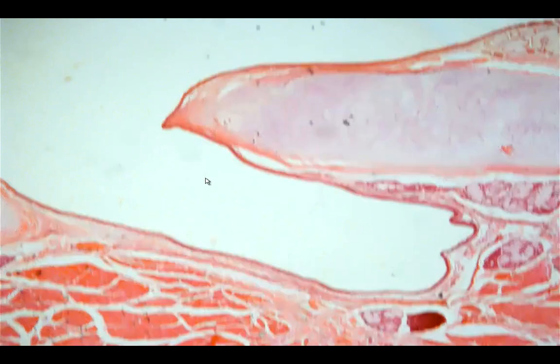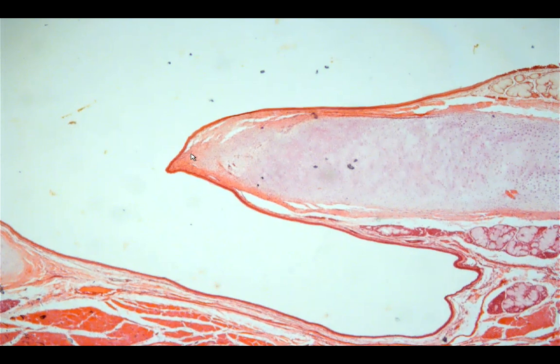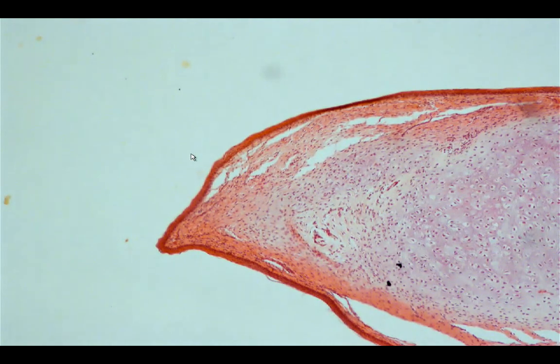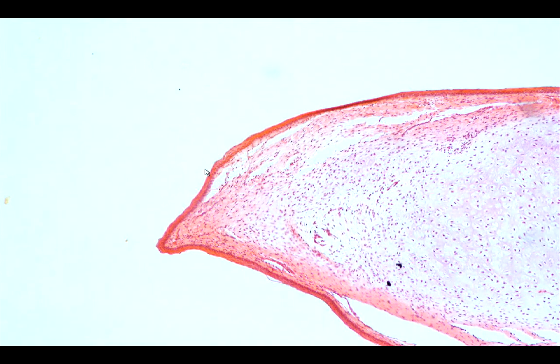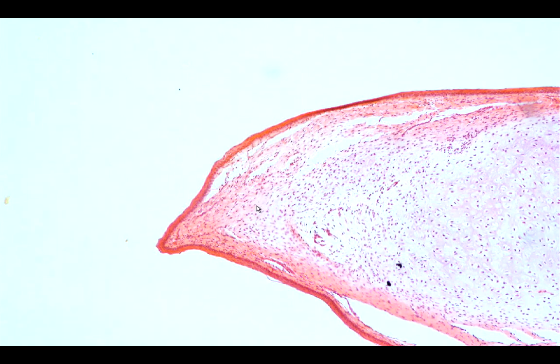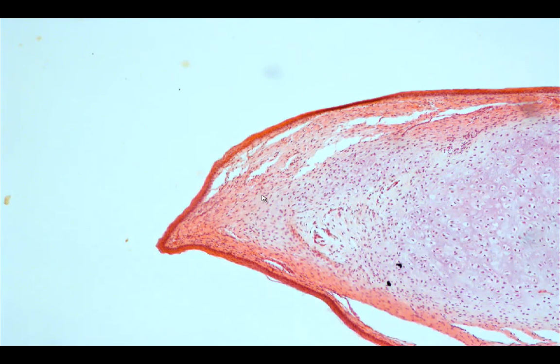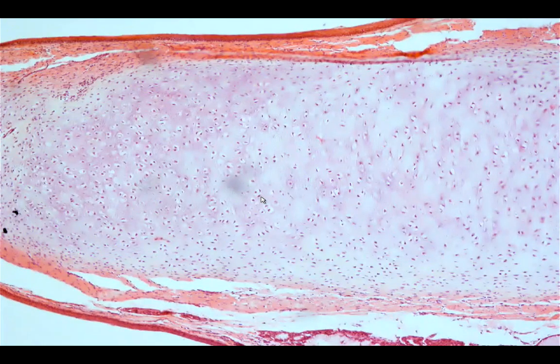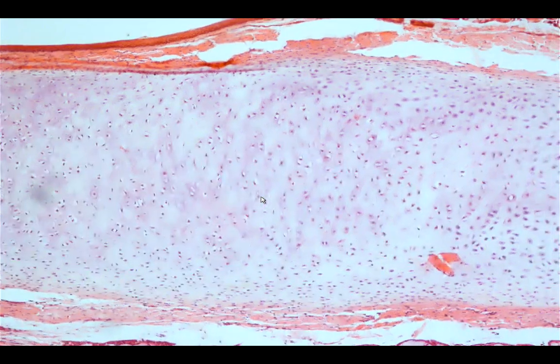The lining epithelium of the vocal cord is stratified squamous epithelium. Underneath, adjacent to the lamina propria, you have the dense regular connective tissue, which is the vocal ligament. There is also a cartilage here, which is the hyaline cartilage.